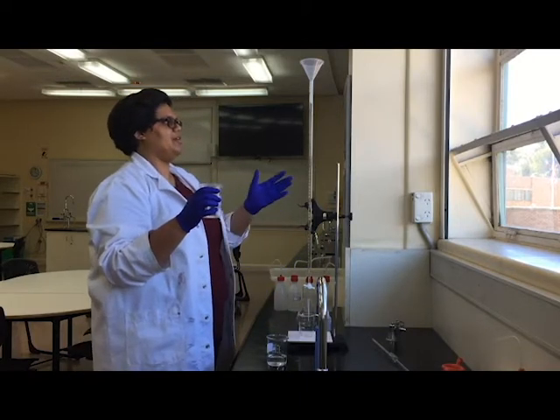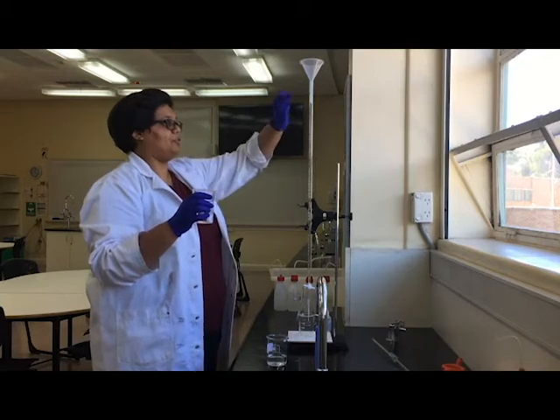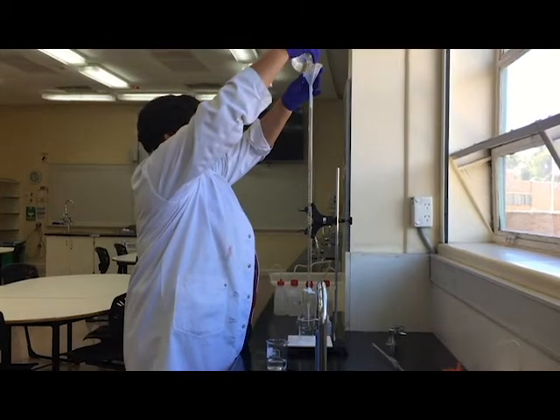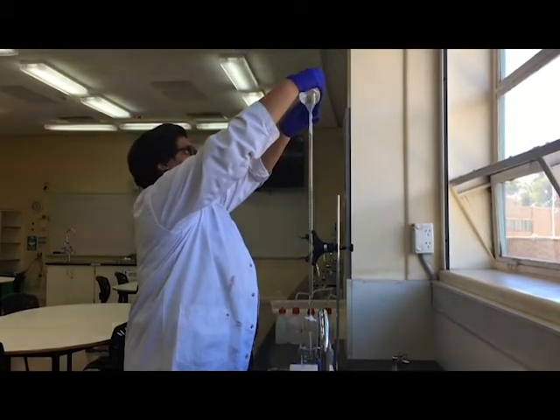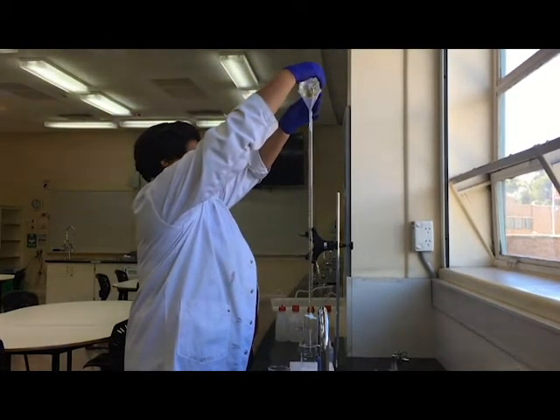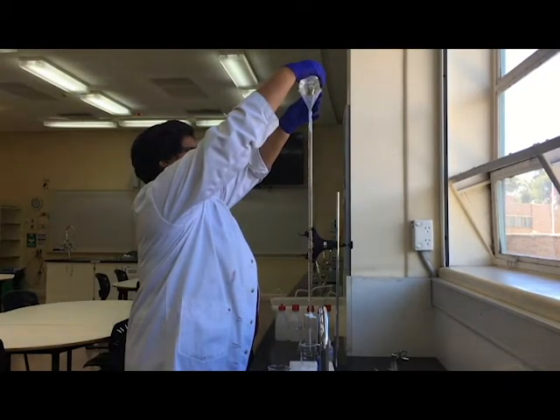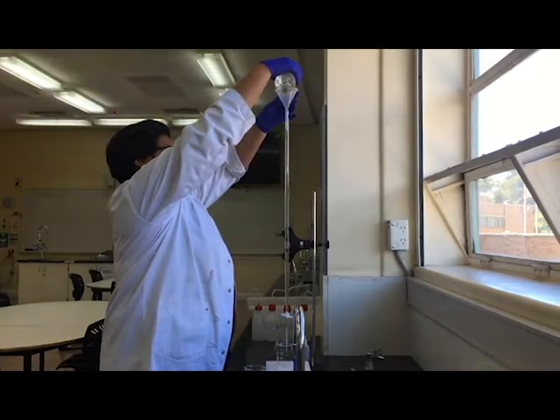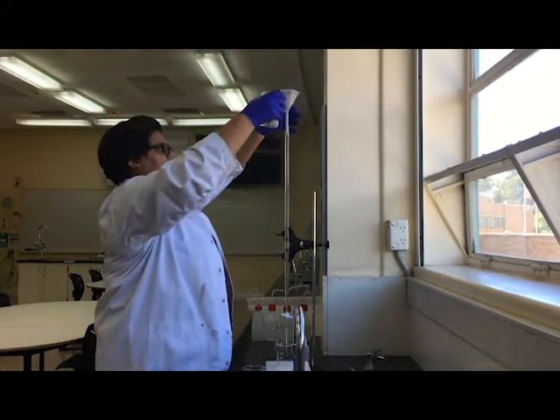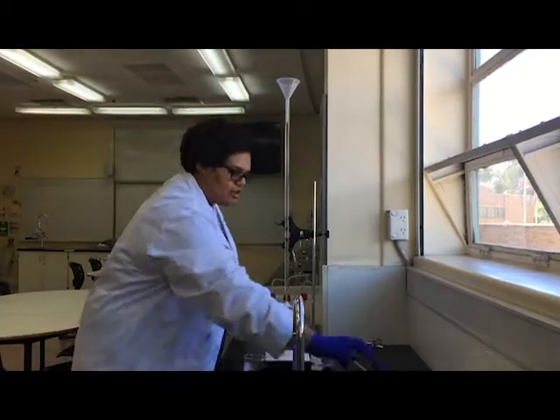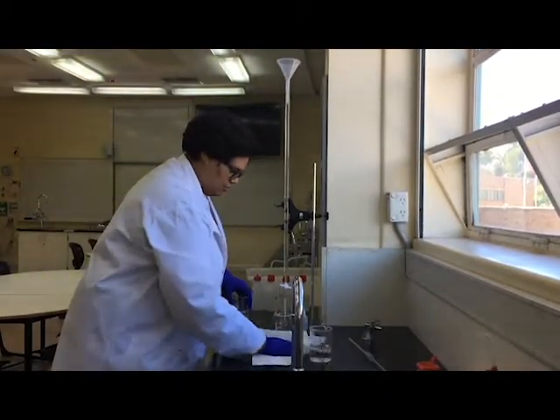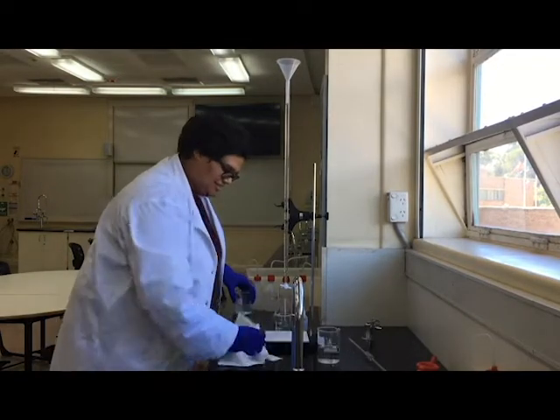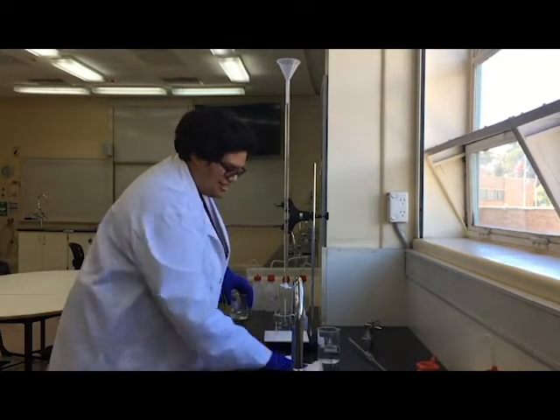Now as I'm filling up, I want to be really careful that I don't overfill it because otherwise it will spill out the top. So I'm going to fill up my sodium hydroxide. Remember, you don't have to go to zero. So I'm a little bit below zero, but that's fine. I'm just going to clean up this mess that I made.